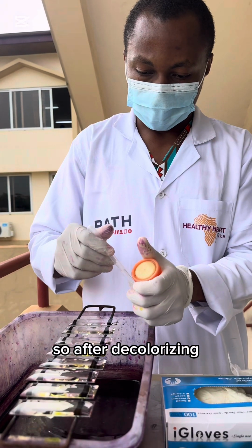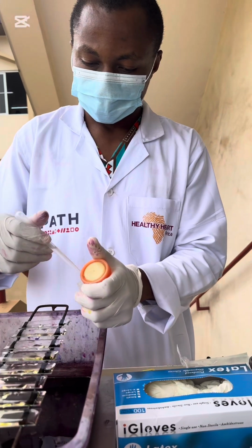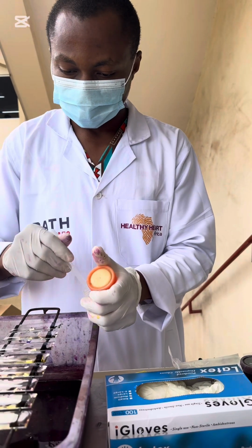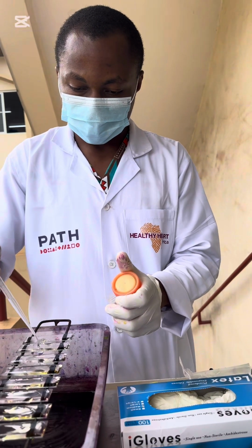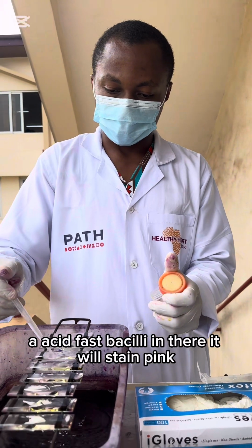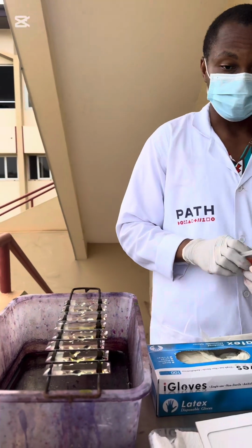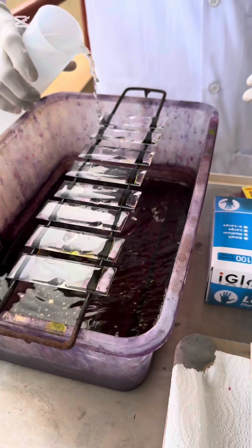So after decolorizing, our smear should be colorless, at least to our eyes. If there is acid-fast bacilli in there, it will stain pink. 5 minutes is on. So you wash.